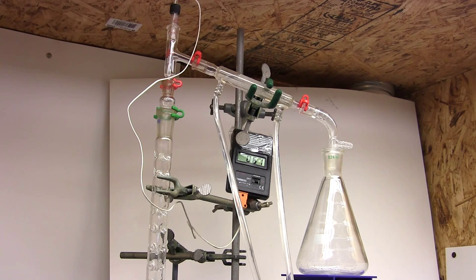But if we go past that into the 64 degree range before we condense then we know we have no acetone. And it looks like that is the case, we're entering the 60 degree range and still nothing is condensed. And it seems we're condensing at around 62 degrees.